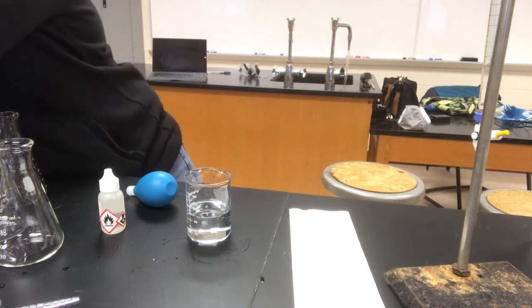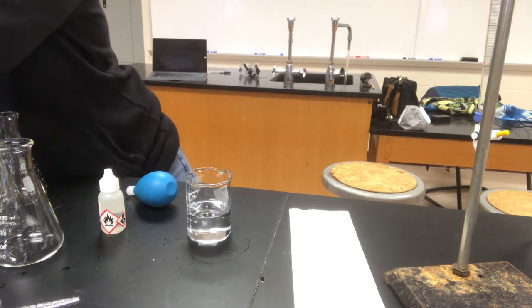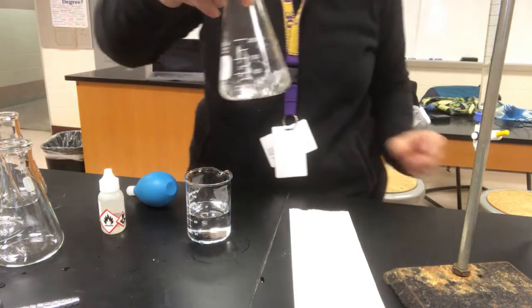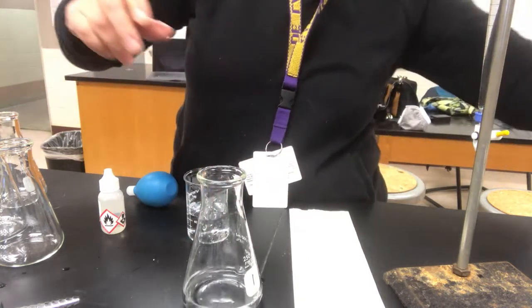Again, that's not going to affect the amount of moles that I'm going to have in the Erlenmeyer flask. The moles will be the same, and it came from 10 milliliters out of this stock bottle. That's the pieces of information that I need to know. But adding a little water is going to help me visualize the end point better when I get there.